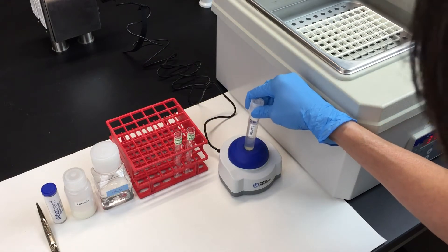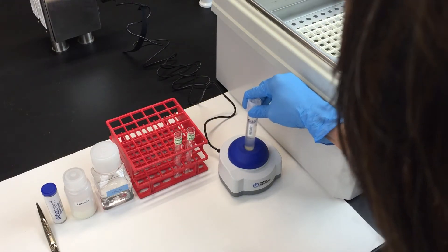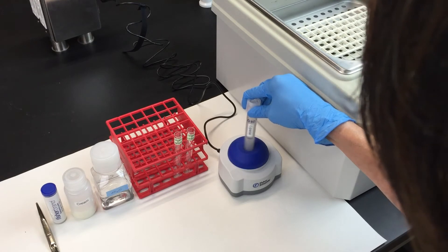Give the lipase a quick mix and add 2.5 milliliters to the cream and lipase tube.